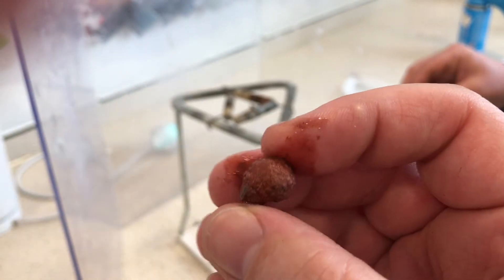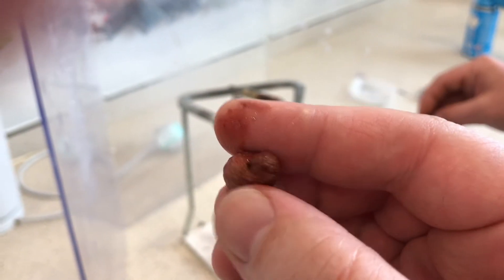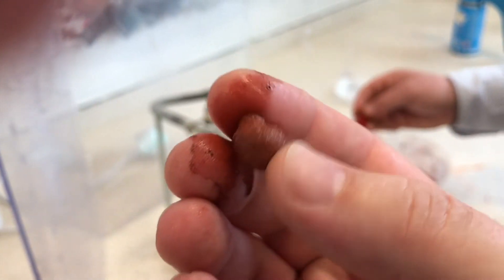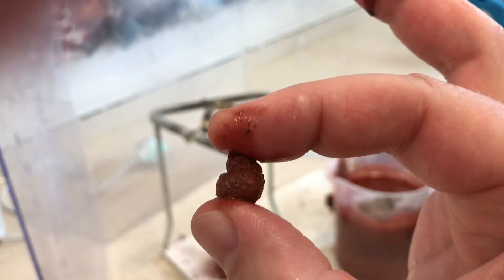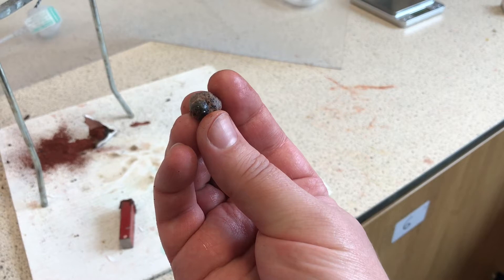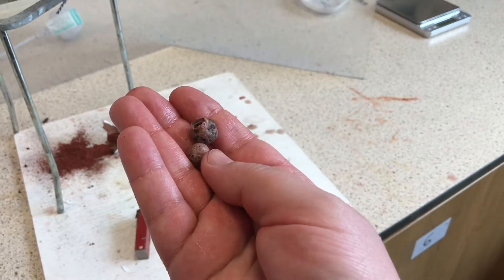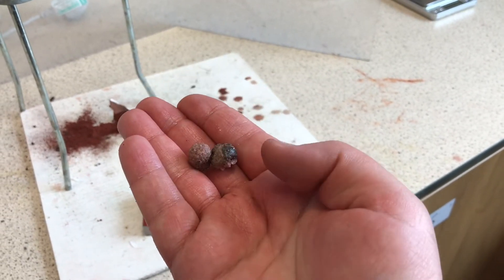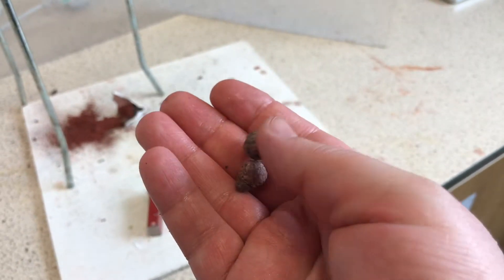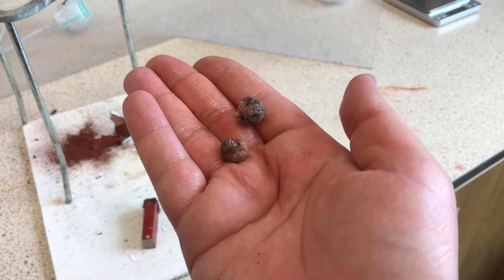Hopefully it's not too hot now — I can pull it off and get a nice close-up. It still looks like it's got iron oxide on the surface, but if we wash that off we'd see underneath that it's a nice shiny iron. It's only a little bit, but we only started with a tiny amount. I've given our little lump of iron a wash, and here's another one from a previous experiment — you can see it looks a lot better when we get rid of the rust. And that's how to make iron — but don't do it at home!